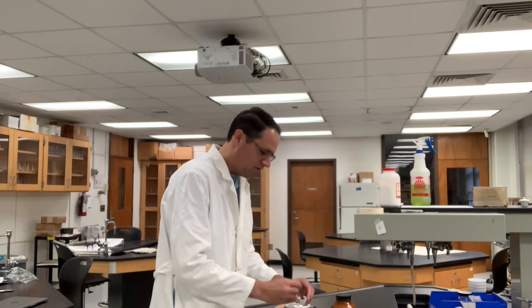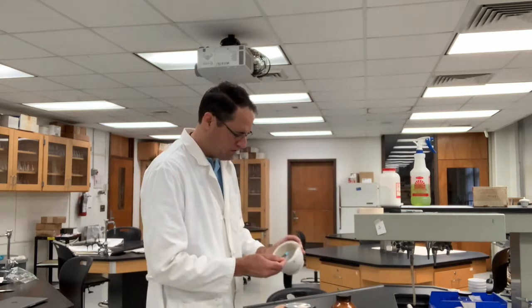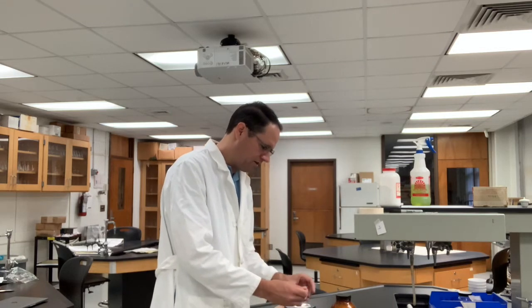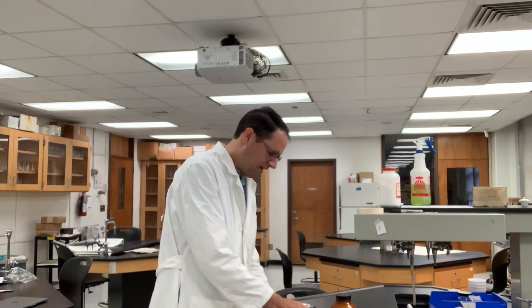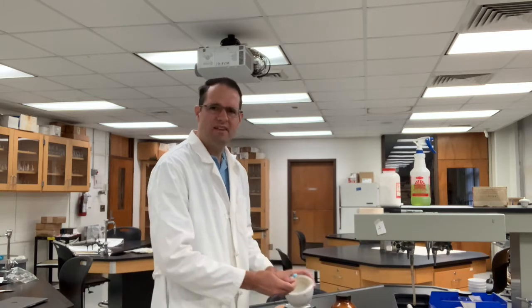This is mainly just a demonstration, so I'm not too interested in reading a procedure or describing all the details or even introducing what a hydrate is. You probably have a lab that describes that already.